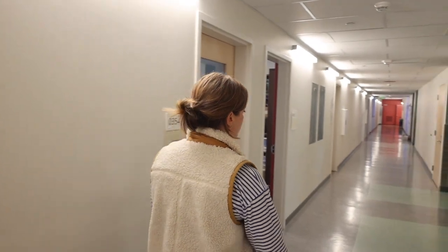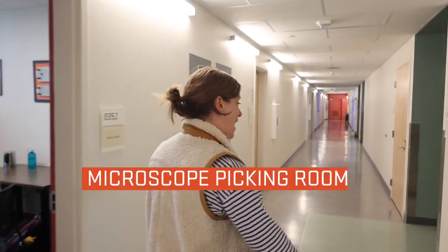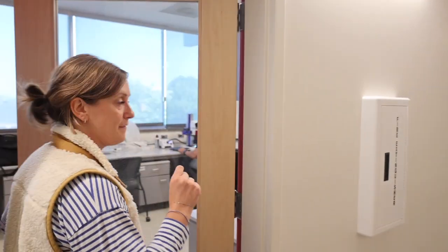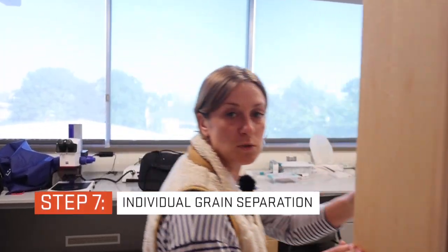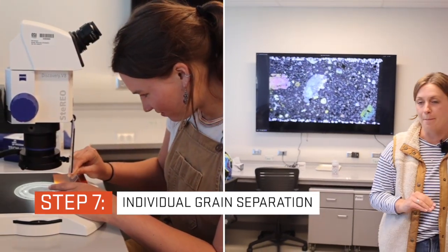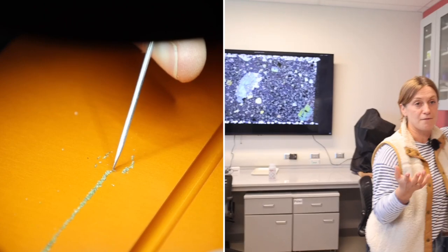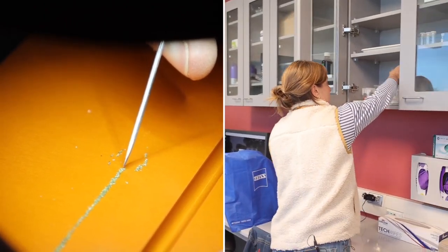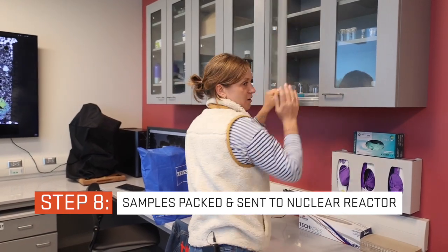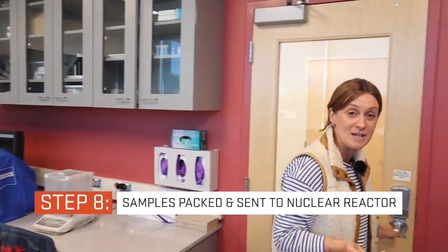And then we move down into the picking room, and this is where we have all the microscopes. Here, we take the sample that we have left, and we individually separate grain by grain. You can kind of imagine separating salt from pepper in these microscopes. After the samples are completely picked, we pack them in these foils and we send them to the nuclear reactor on campus to be irradiated.